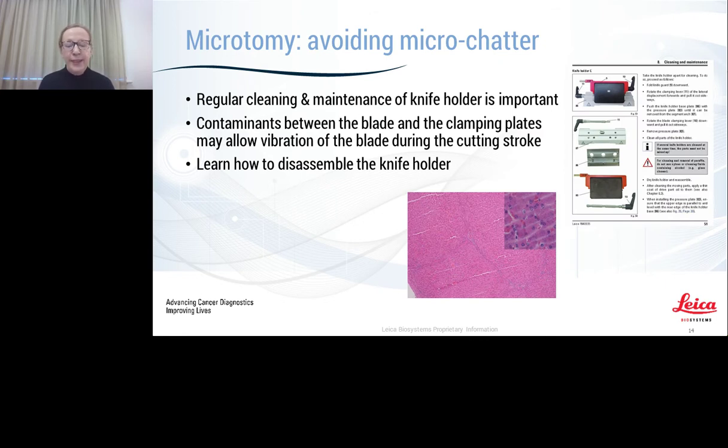The other thing that's really important and is probably, again, overlooked by a lot of lab staff is to actually clean the microtome, but learning how to actually take apart the knife holder is really important. There are instructions, and like many, many instructions, people don't usually read them. But it is really important to have some idea, or at least even have a nominated person in the lab who does know how to correctly maintain the microtomes. There is an image here of microchatter, and again, this is often attributed to poor processing, when in fact it could just be that it's chatter right through the block because it's a loose blade.